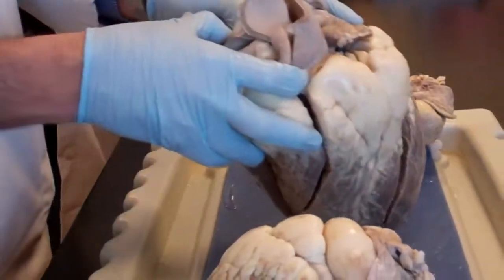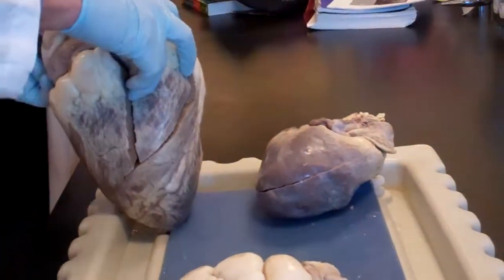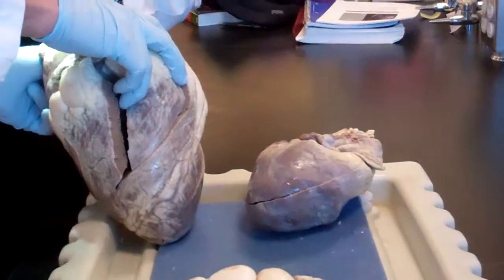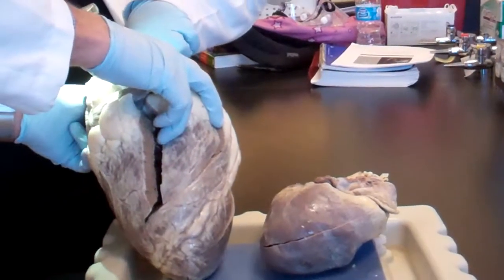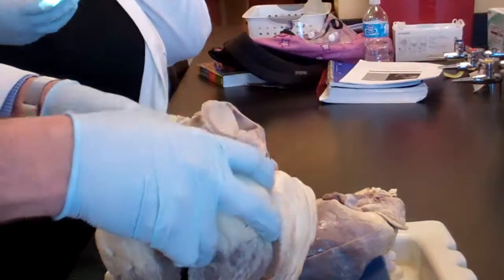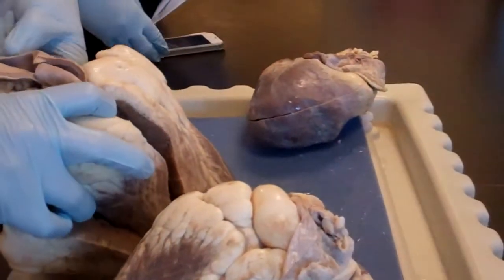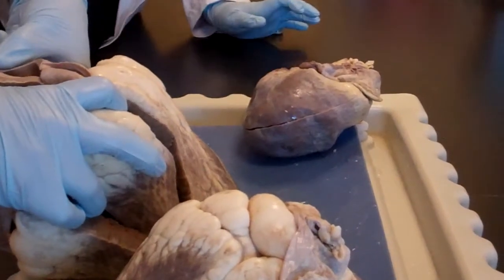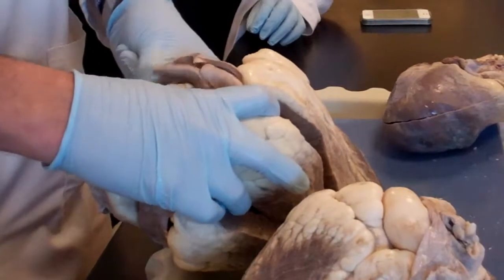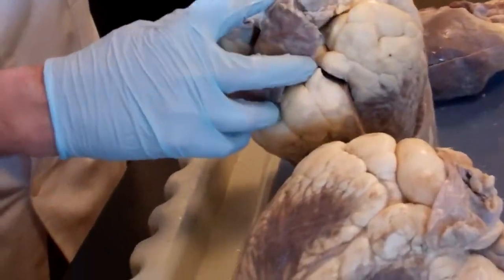Who has clean hands? You have a flashlight? Well, that's not a flashlight, it's an iPhone. Told you it's not going to help you. You know what? I have a little light. Put your hand in my pocket, please. Don't take any money, okay? Put this light, turn it on.